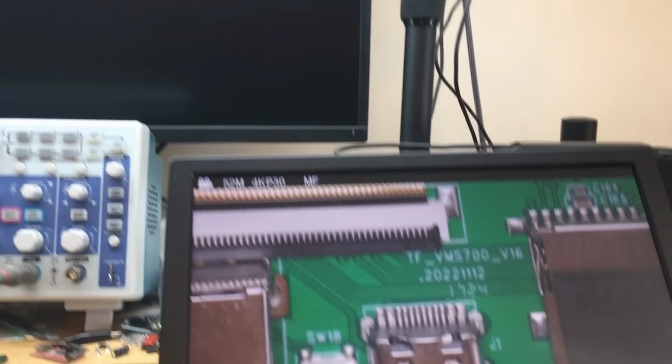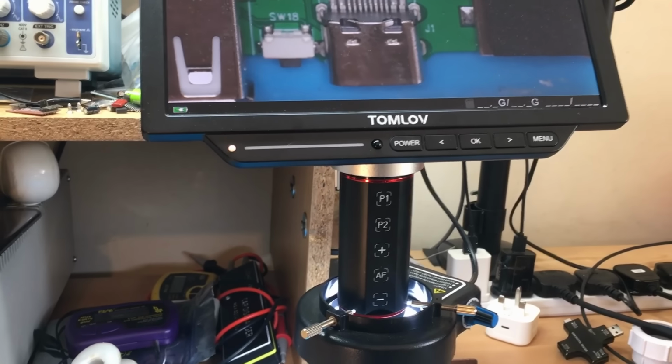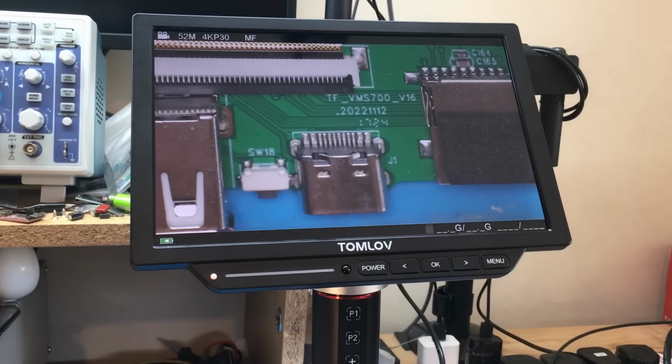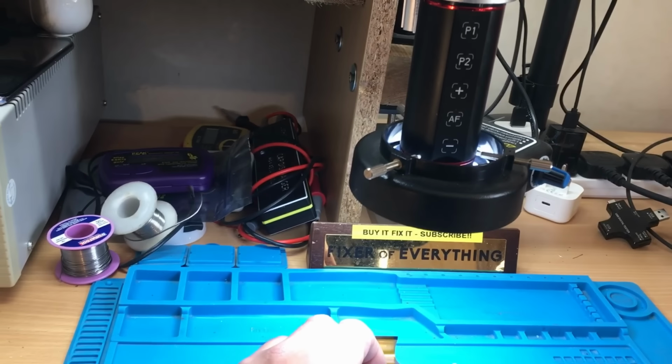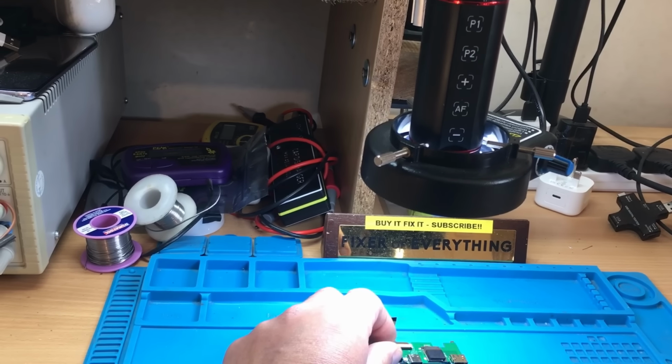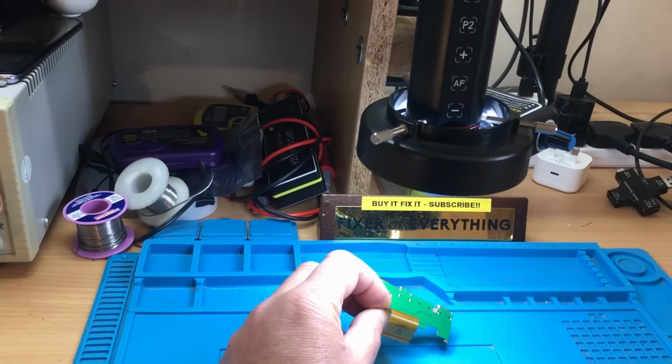So what they've done is they've sent me this little subboard here, which they've included a little microphone on. So hopefully, the plan is we're going to upgrade this. We'll fit this little board down here, but we'll also have a poke around inside of this. We'll see what makes it work and see if there's anything like any debug headers or anything like that, which might be good for a little bit of hacking with it as well.